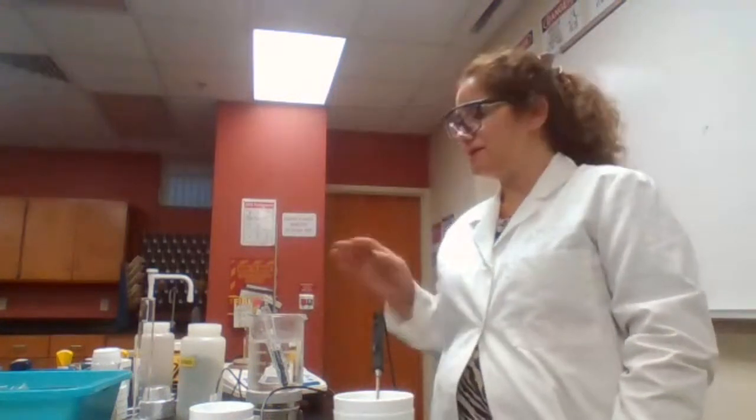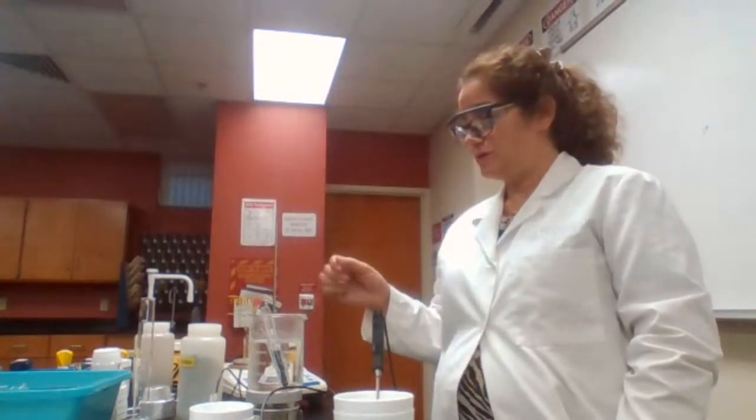Since you have a 6:09 and 6:12, I'm just going to wait extra minutes so we can make sure that it's going to be hot.